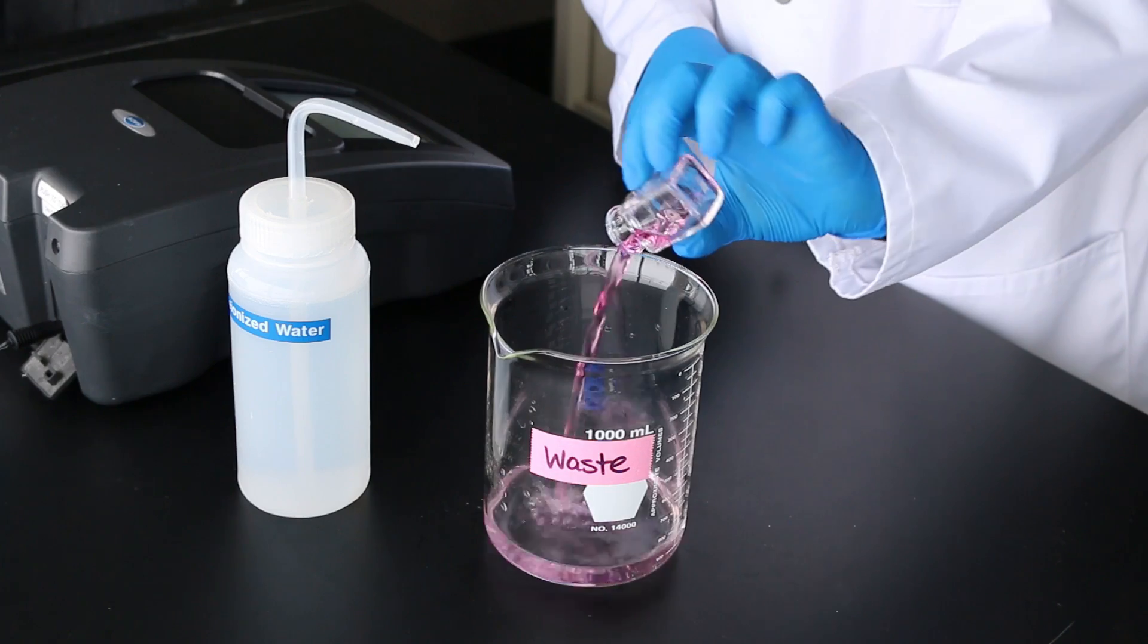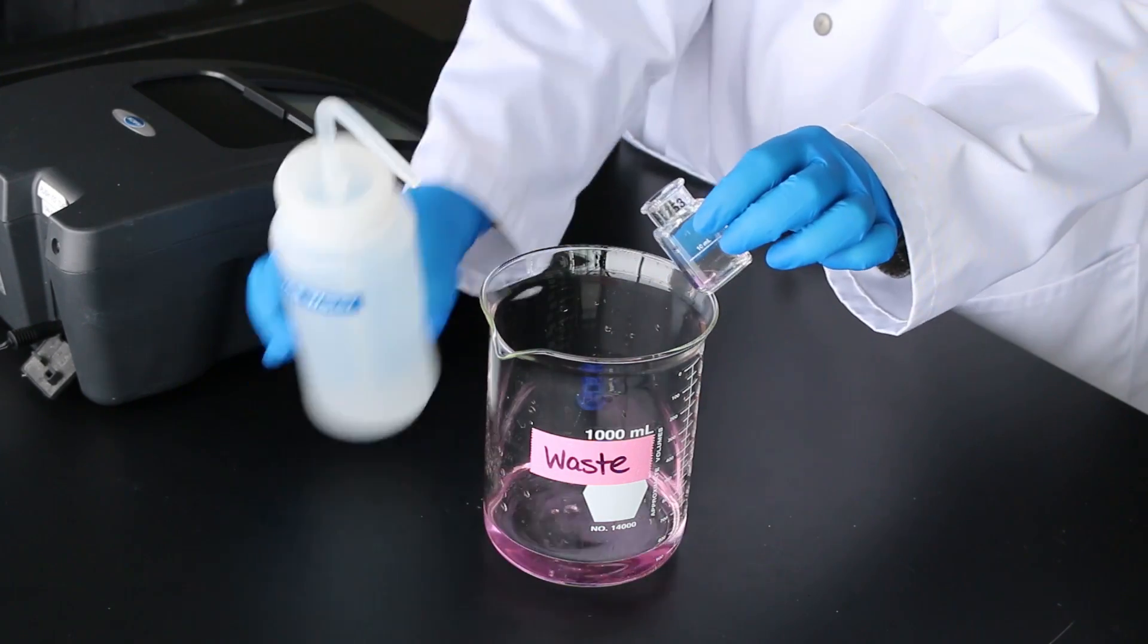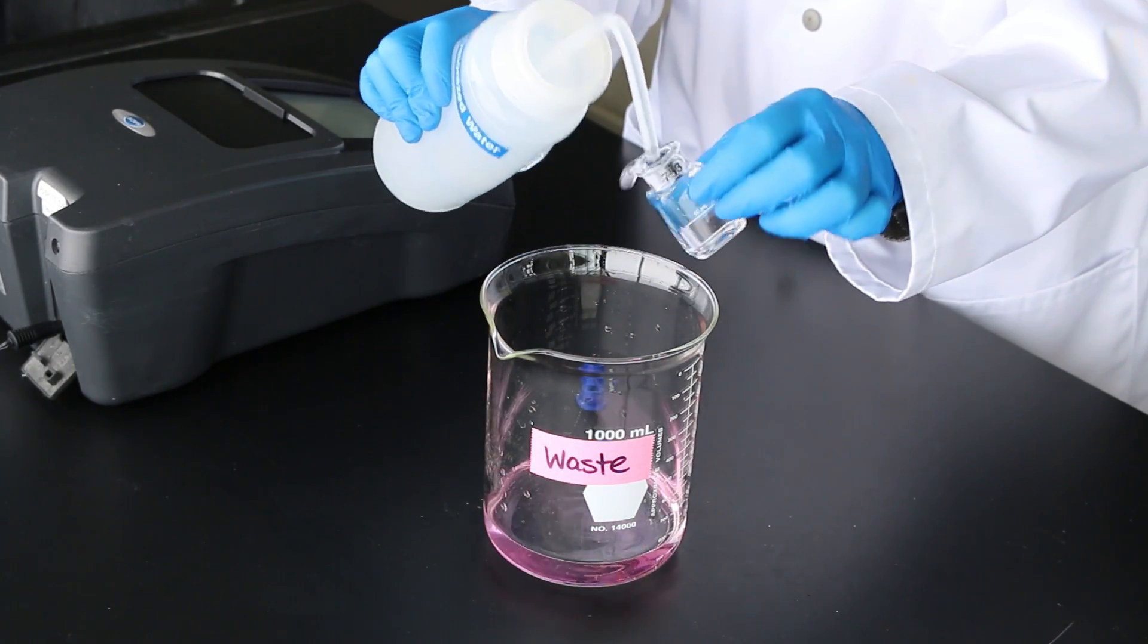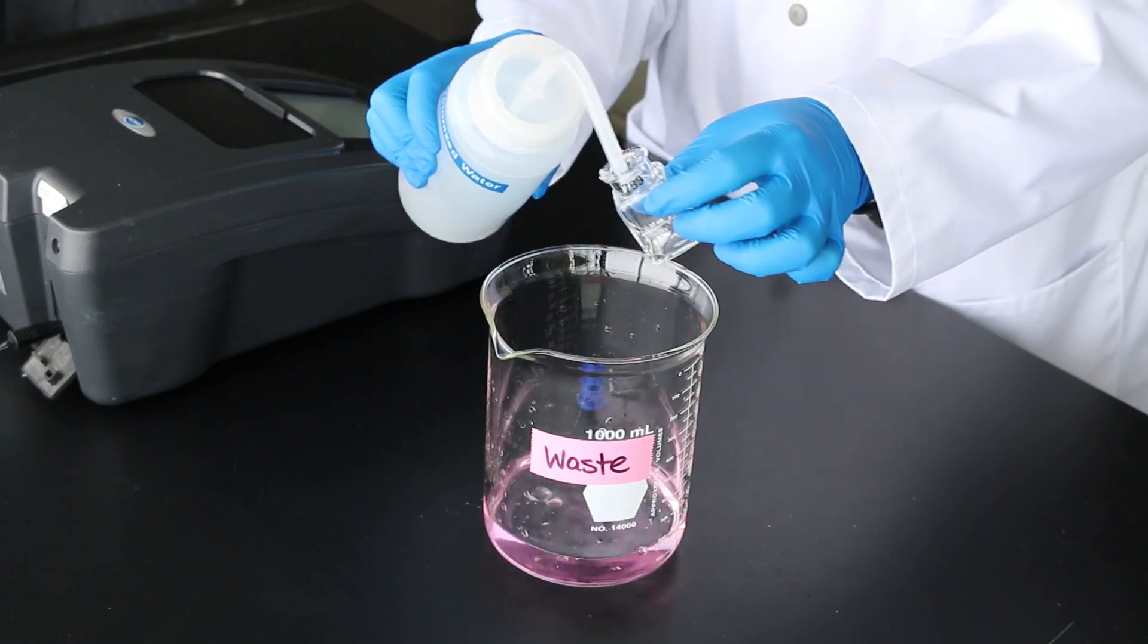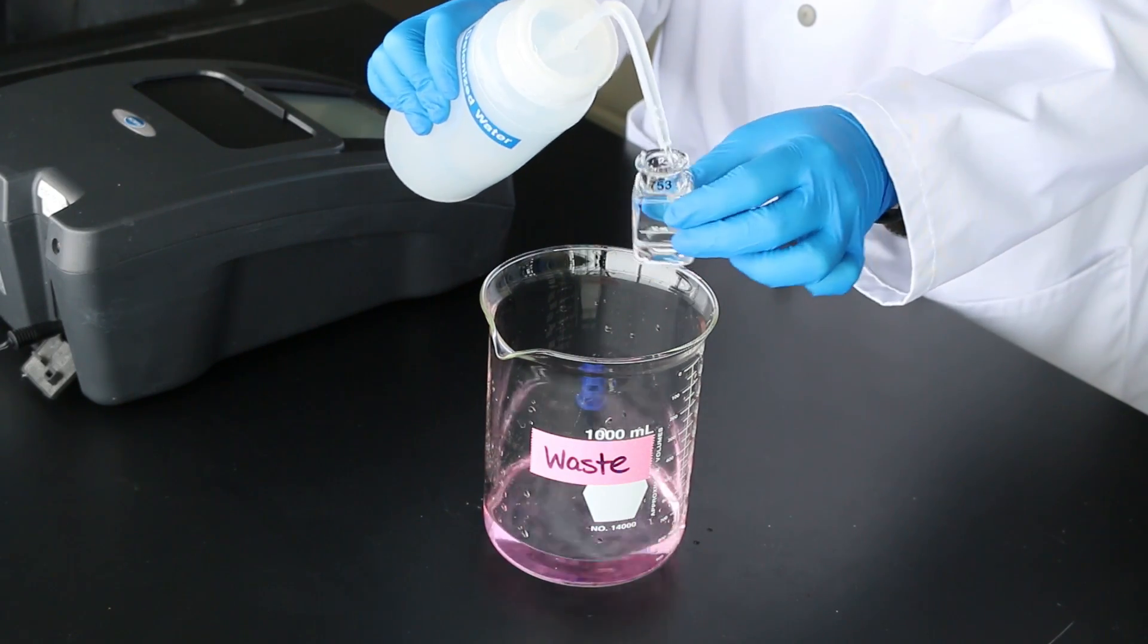Ensure the cells are cleaned promptly following analysis as the DPD reagent can permanently stain cells. Dispose all reacted solutions according to applicable regulations.